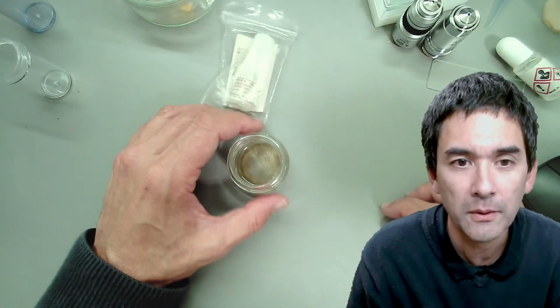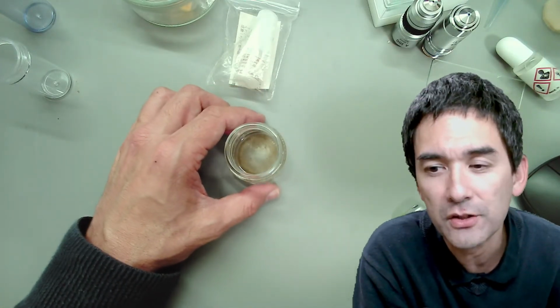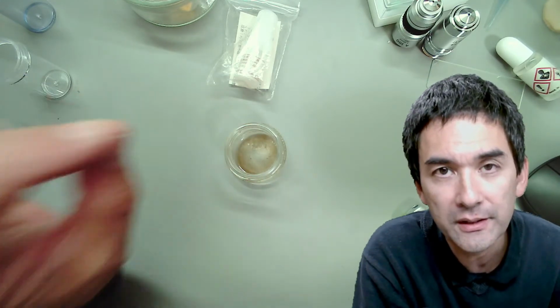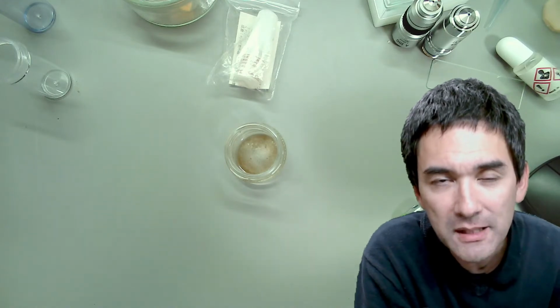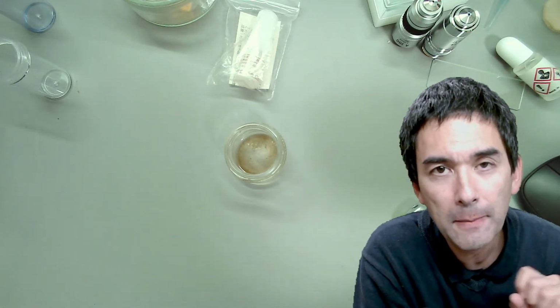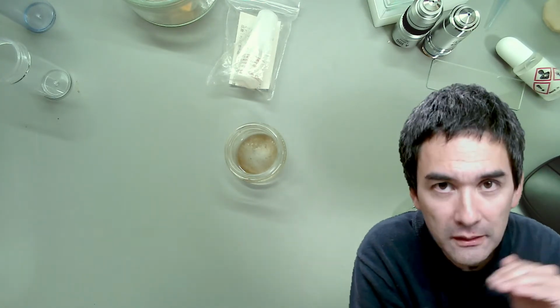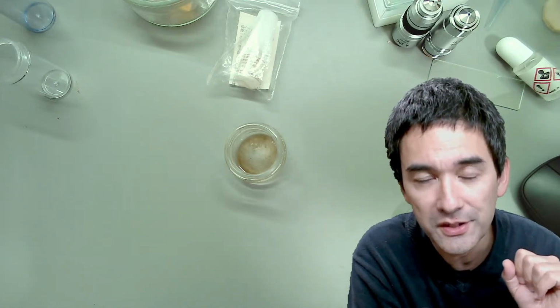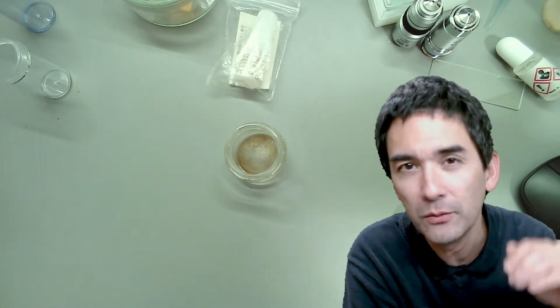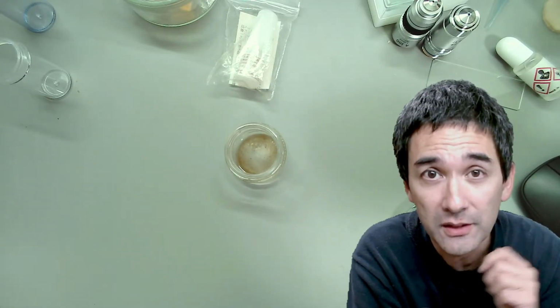When you work with high magnification, something that is really important is that you make sure that the specimen is very, very thin for several reasons. The specimen has to be thin because the depth of field is very low, obviously. This means that if you have some vertical movement of organisms, then they will immediately go in and out of focus, and it's very difficult to see. So that's number one.